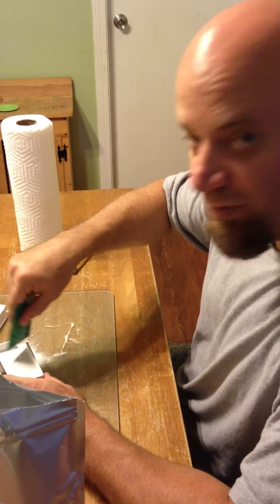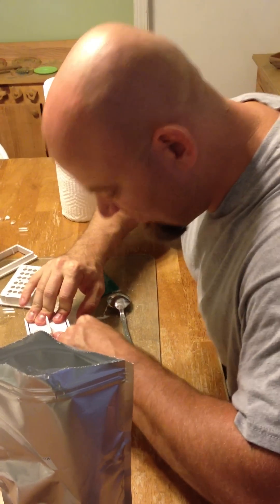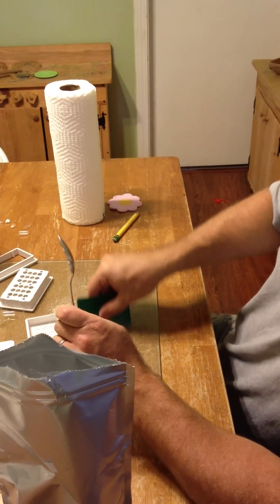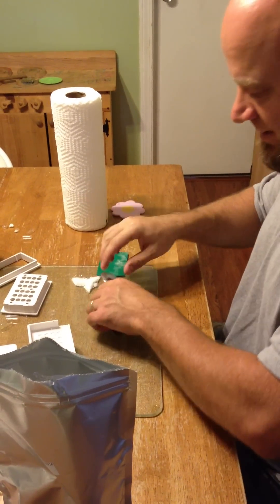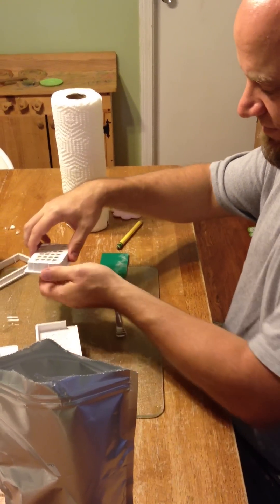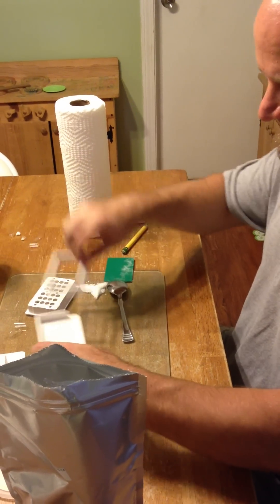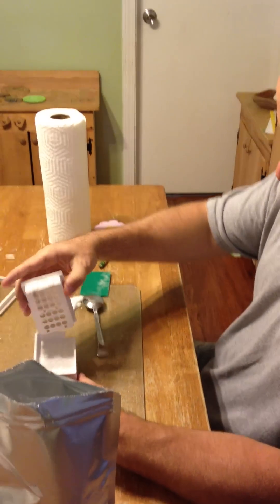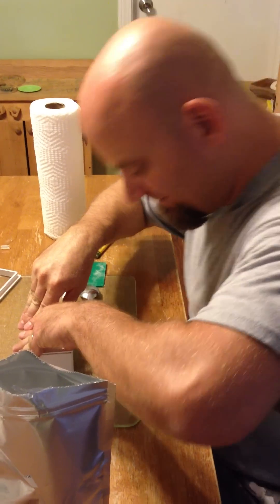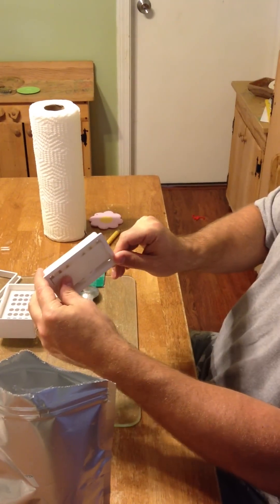So then you go over it one more time. It is a supplement — a brain supplement. What I do is just tamp it one more time, even though there is really not that much room. Then get the Piracetam out of the way, take it off the base — this was the base that normally sits on like that. It fits perfectly; tamp it down, then take the bottom of it and push them all out.